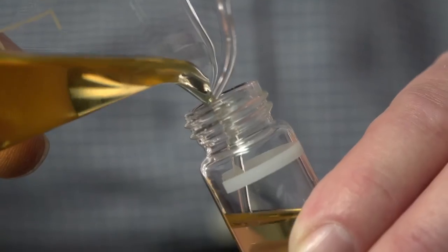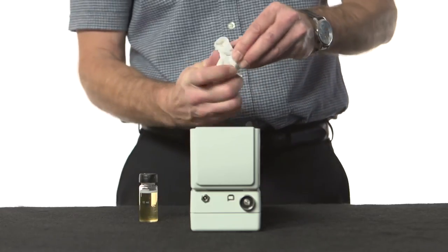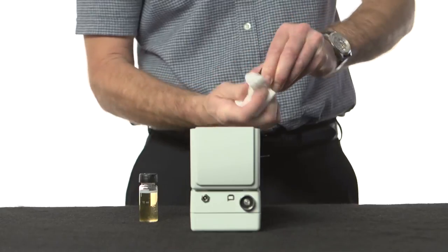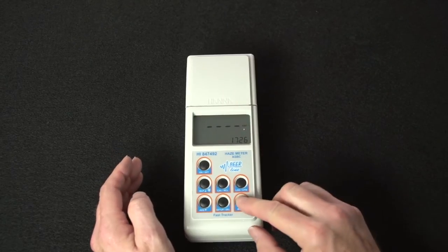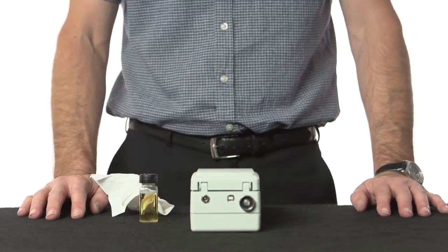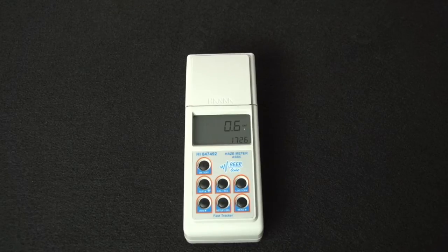This beer and ethanol mixture is then gently poured into a cuvette, which is wiped thoroughly to remove any moisture, dust or fingerprints on the glass, before being inserted into the haze meter. This first haze reading is referred to as the permanent haze — the background base level haze of the beer sample when warm.